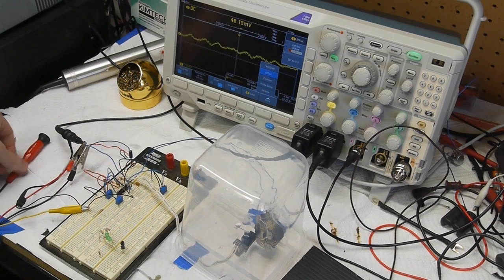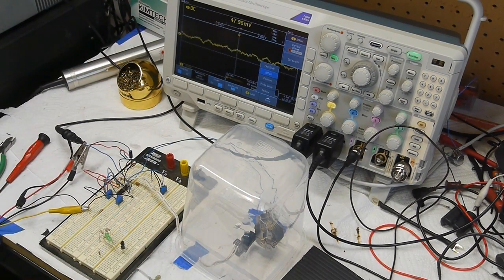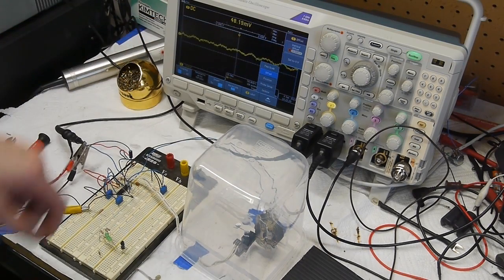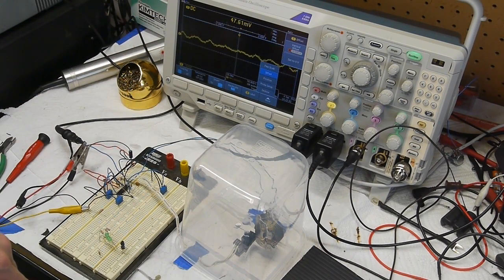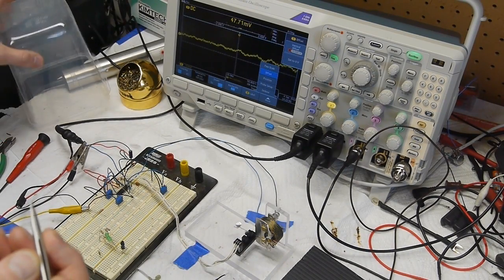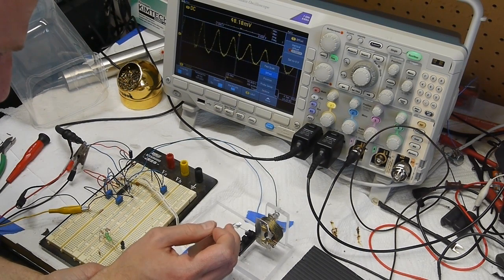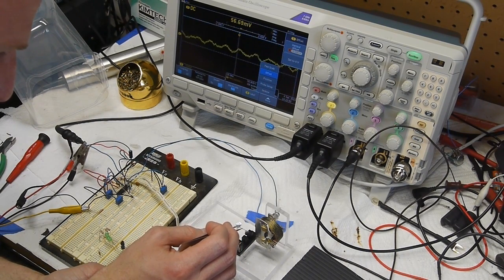So to check the scale just quickly to see, you know, approximately what the precision of this thing would be, I'll put the 1 by 1 millimeter piece of paper on there. So currently I've got the plastic bin over the top just to keep air currents down, and it's coming in at about 48 millivolts, let's say. There's quite a bit of noise, and I haven't really done a whole lot to reduce the noise. Okay, so I'll lift the plastic cover up and place the 1 by 1 millimeter piece of paper here.